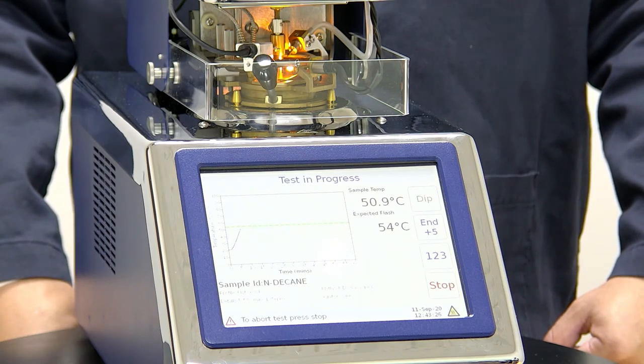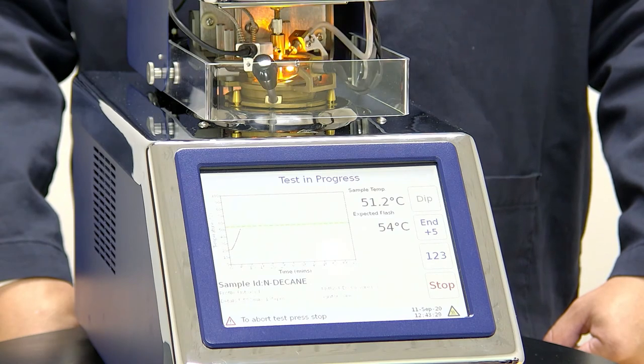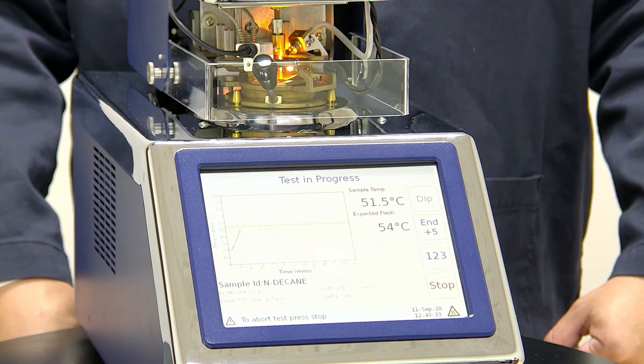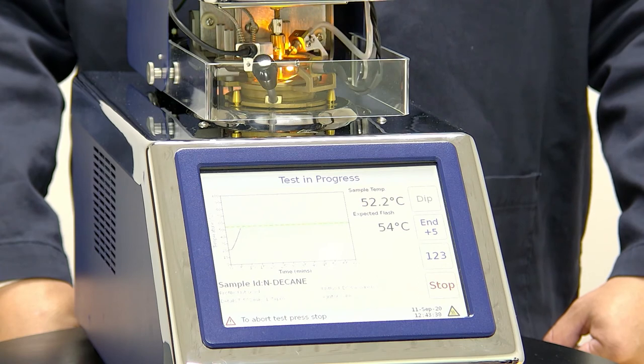We're now only a few degrees away from our expected flashpoint. The instrument will automatically detect the flashpoint when it flashes and will stop heating and start cooling down along with giving us our final measurement screen.